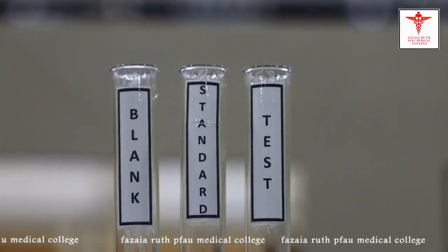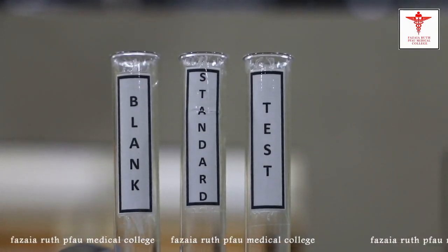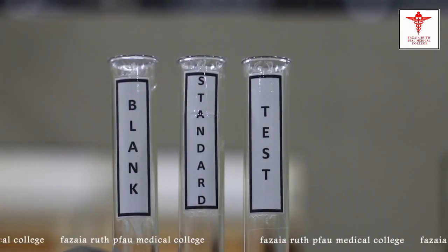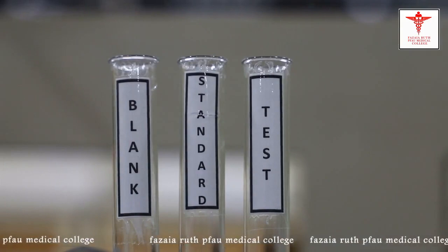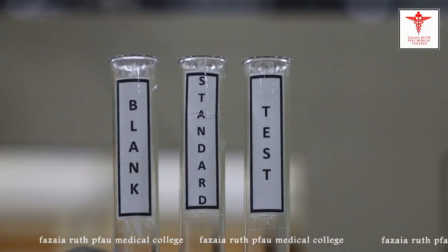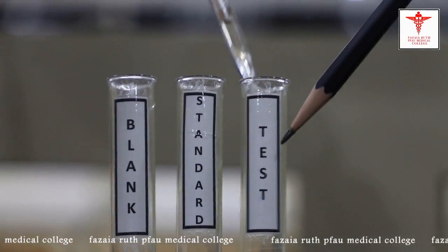Now the sample that we have prepared — we'll take 0.1 ml of that sample and insert it into the test tube which is marked as 'Test'.